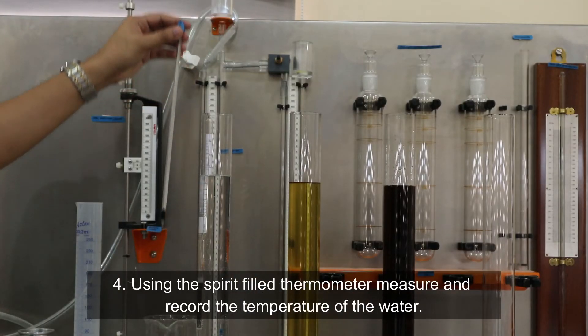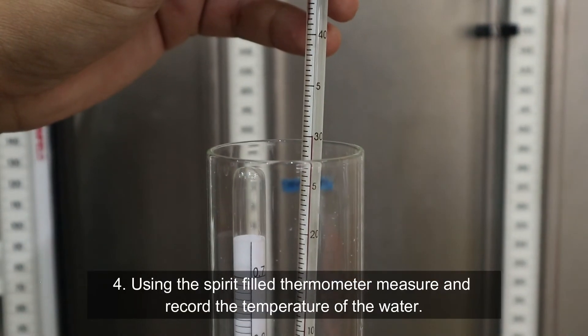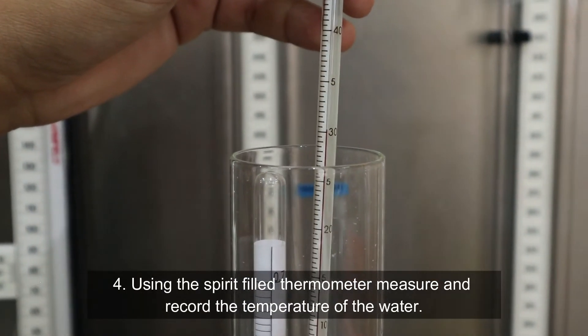Fourth, using the spirit-filled thermometer, measure and record the temperature of the water.